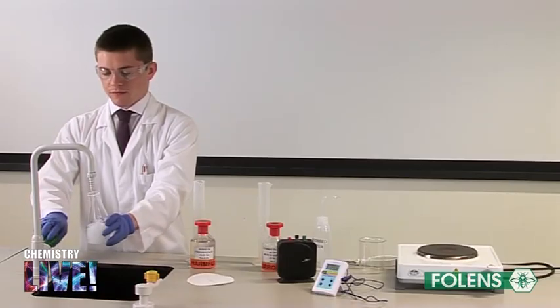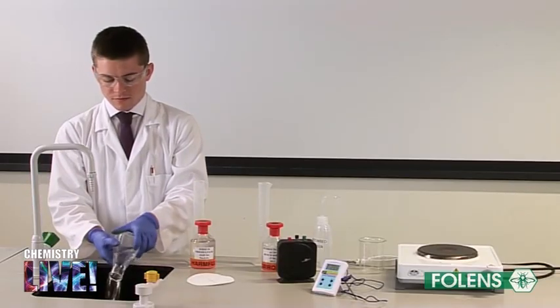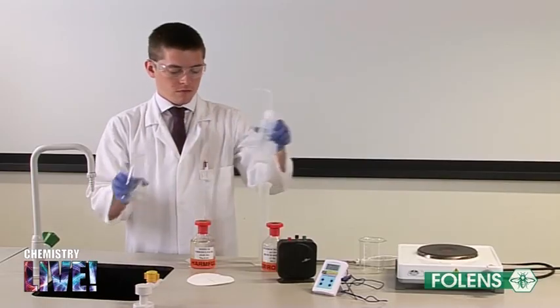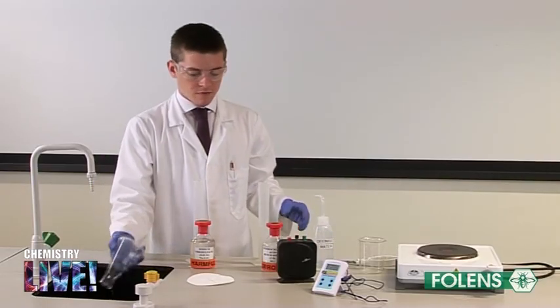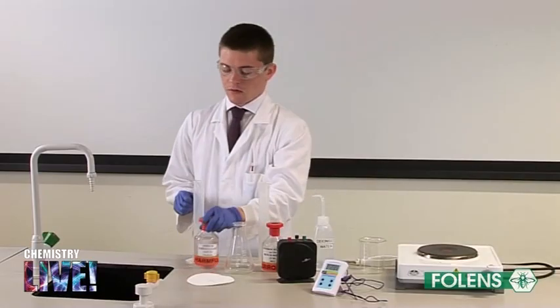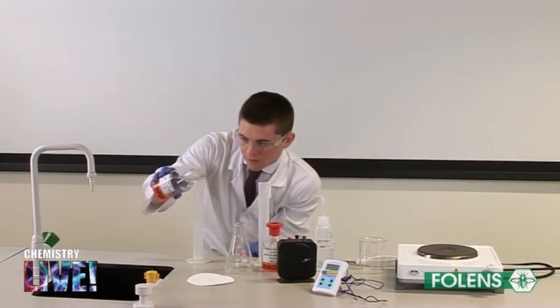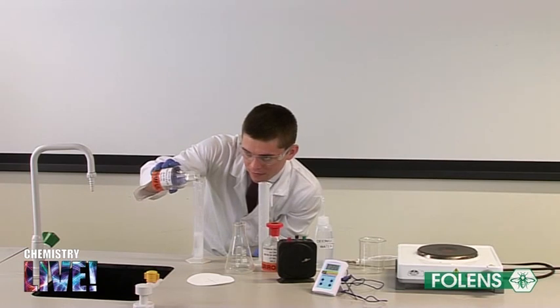Wash out the conical flask. Pour 100 centimeters cubed of the 0.05 molar sodium thiosulphate solution into the flask.